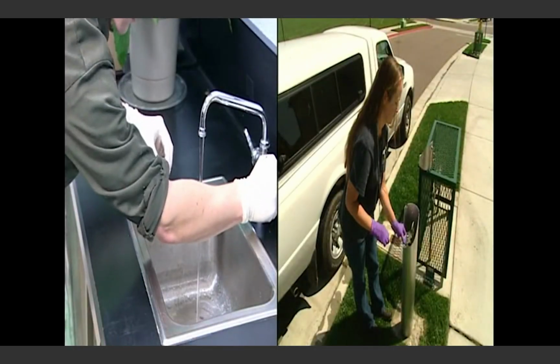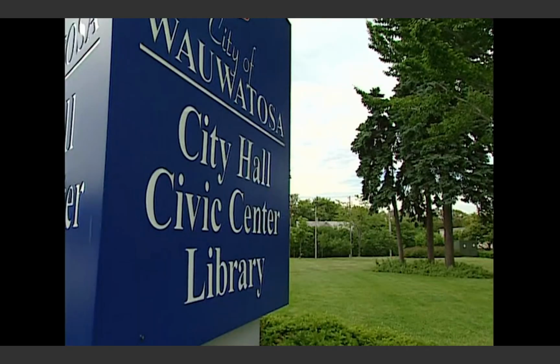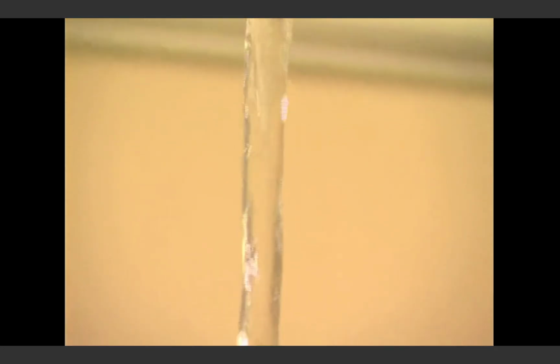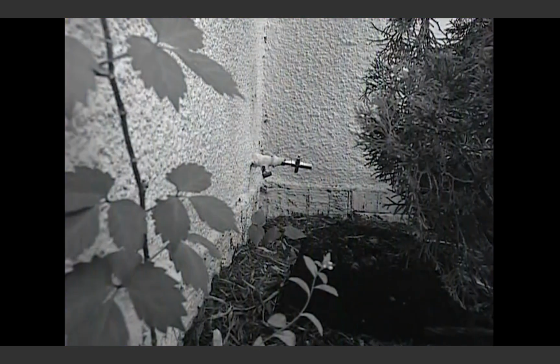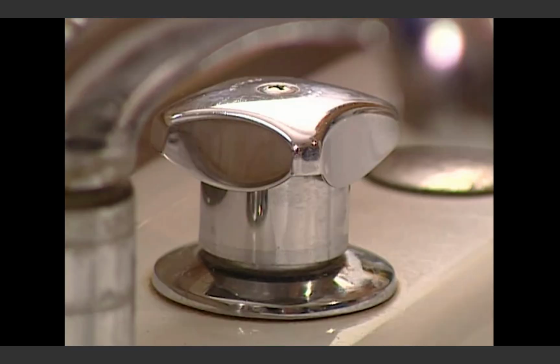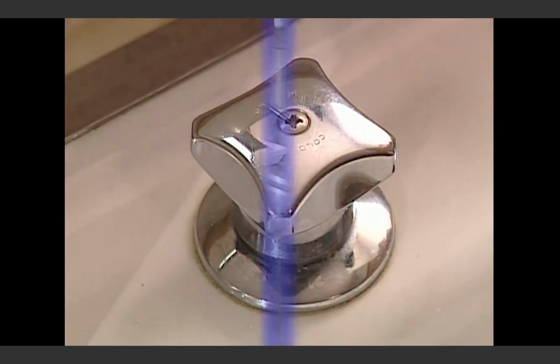Systems may use different sampling locations when they collect samples, or they may use fixed sample locations. Sampling sites may include public or municipal buildings such as libraries, fire stations, and schools, or may be located in the homes of customers. The faucets should be carefully selected to provide samples that are representative of the water in the local main and not of the customer's plumbing system. Sampling faucets should not be located near the ground and, if possible, should be inside a residence or building to avoid environmental contamination. Faucets utilizing separate controls for the hot and cold water should be chosen, with only the cold water tap used for sampling.